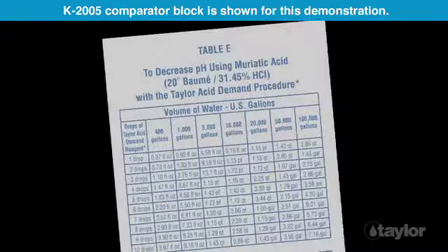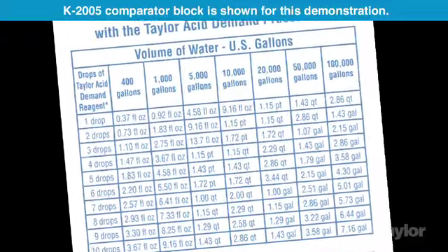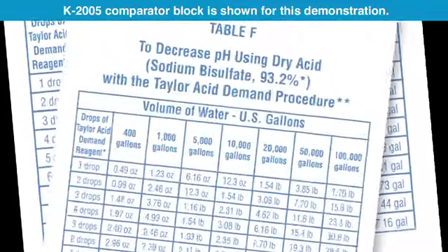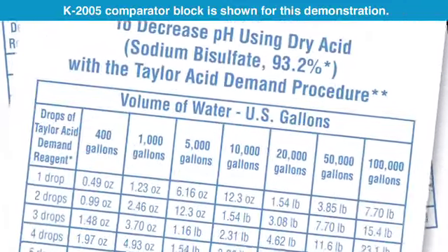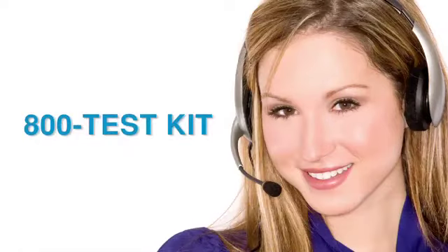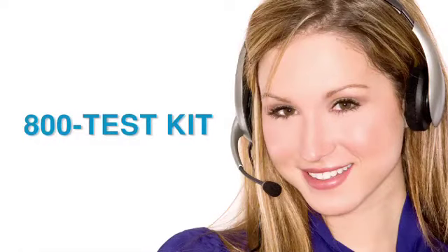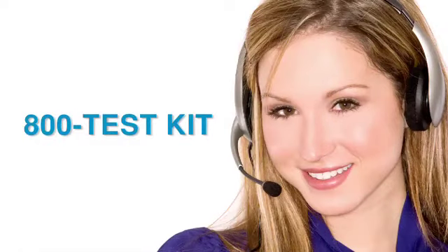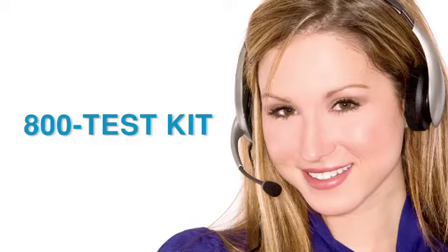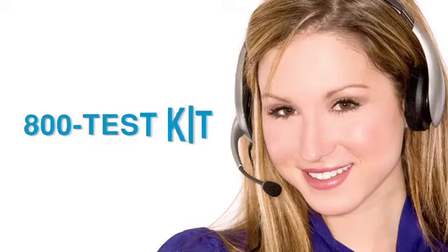See the treatment tables in your guide to continue. Taylor's knowledgeable customer service representatives are available to provide technical assistance about our products. Call 800-TEST-KIT.